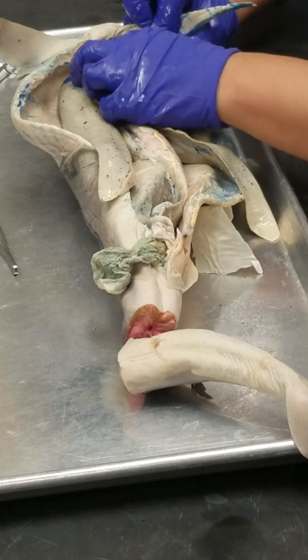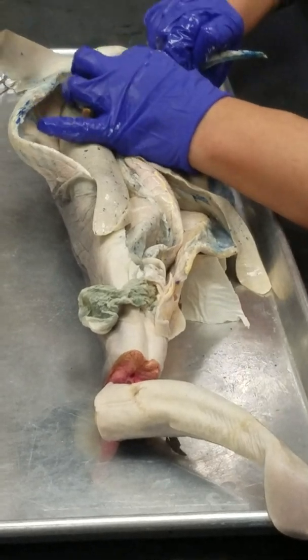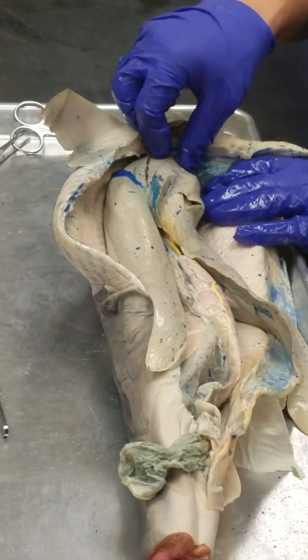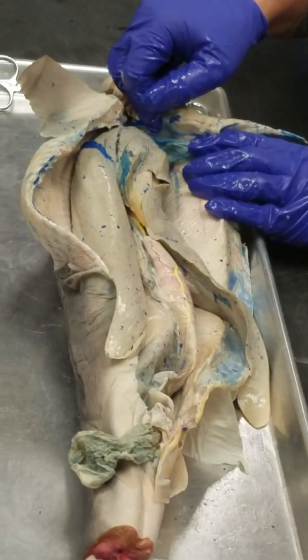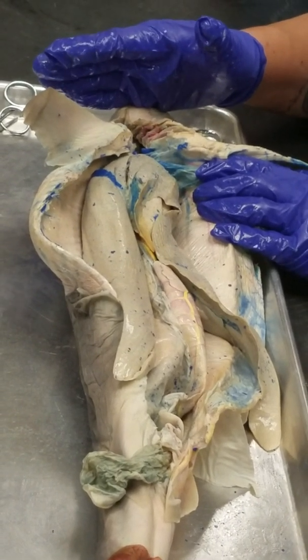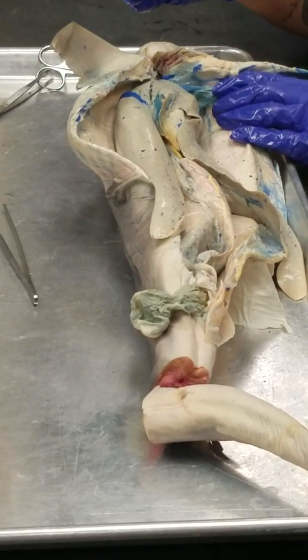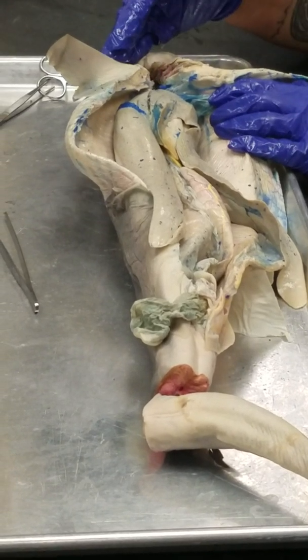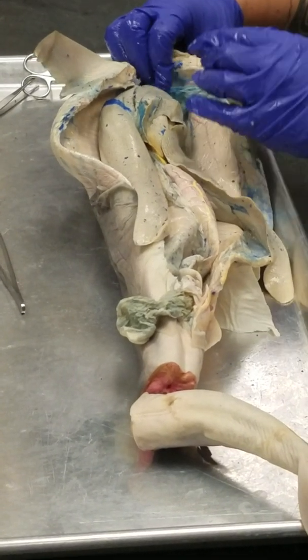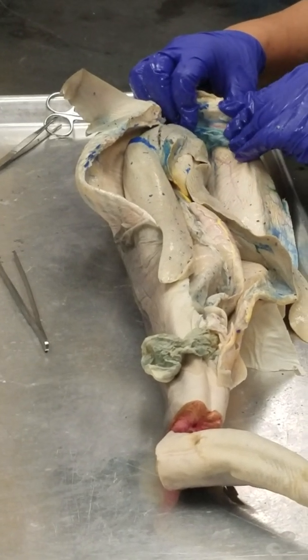But look at the anterior part of the liver. Look at it. It has this little membrane here. Can you kind of see it? It's just this little membrane, and that membrane is called the falciform ligament. We're going to see the falciform ligament in all of our vertebrate examples in the lab. And that's our only ligament that attaches organs to the ventral body wall. All of our other ligaments and mesenteries will attach the organs to the dorsal body wall. So the falciform is always at the anterior of the liver, always connects the liver to the ventral body wall.